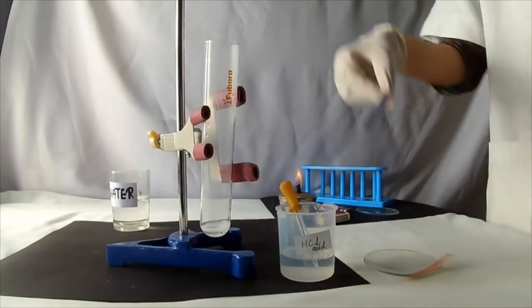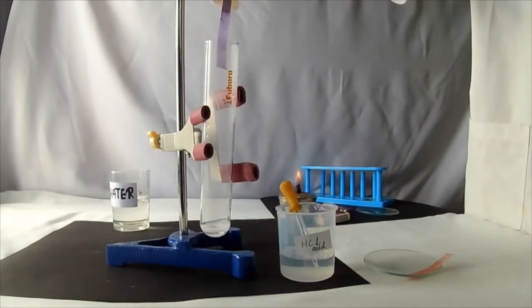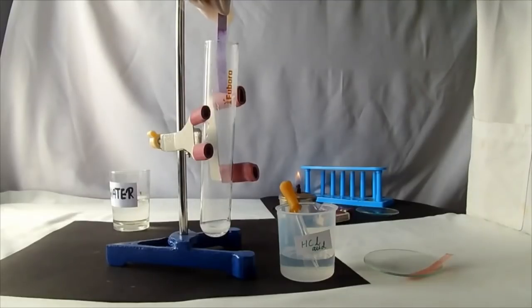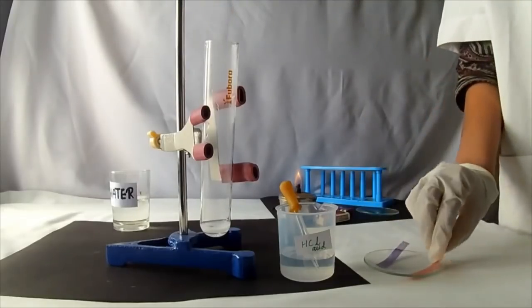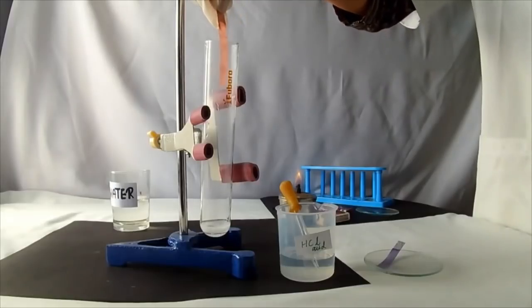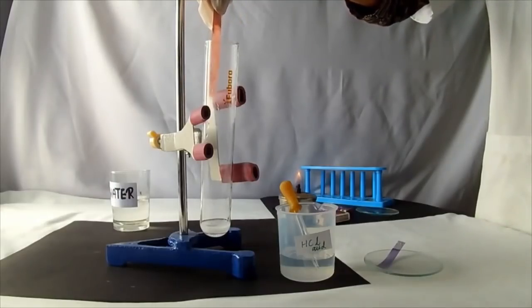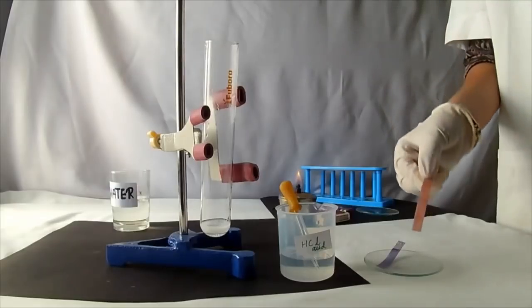Test the nature of the gas using the red and blue litmus papers. They do not change color, inferring that hydrogen is a neutral gas.